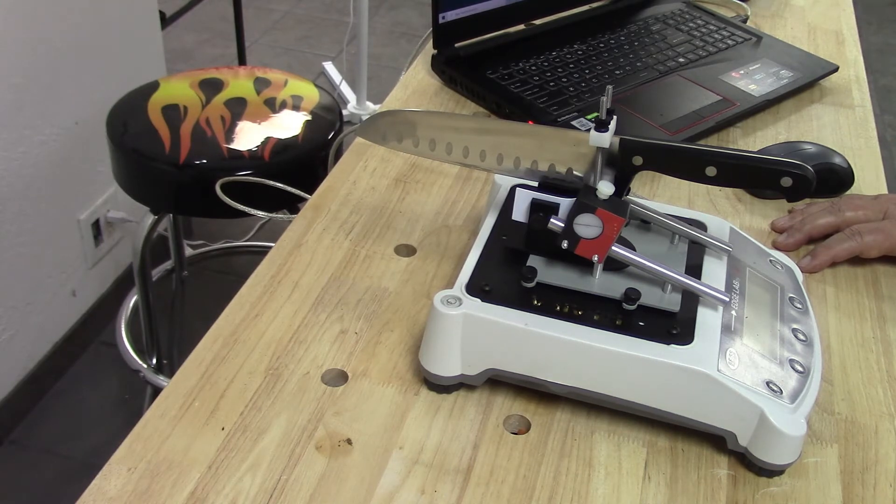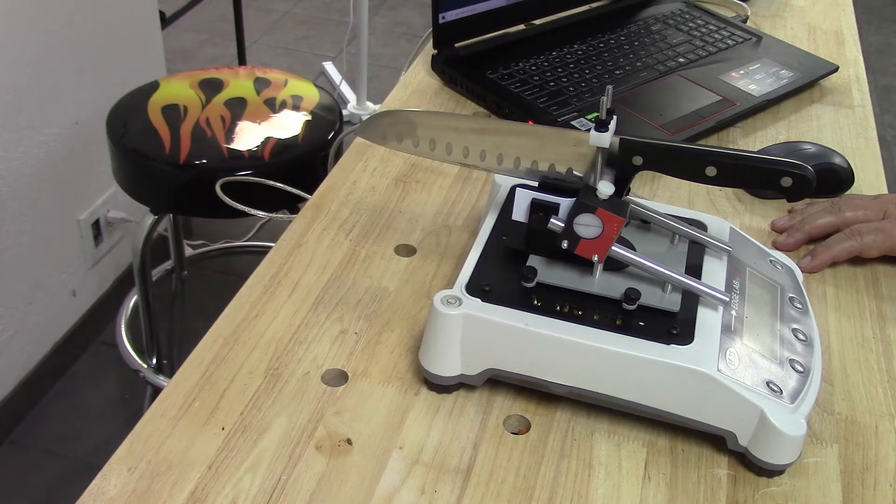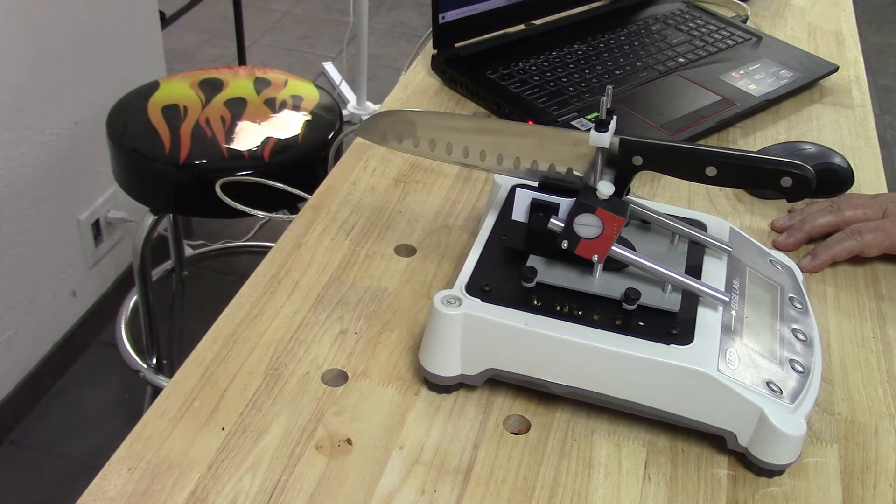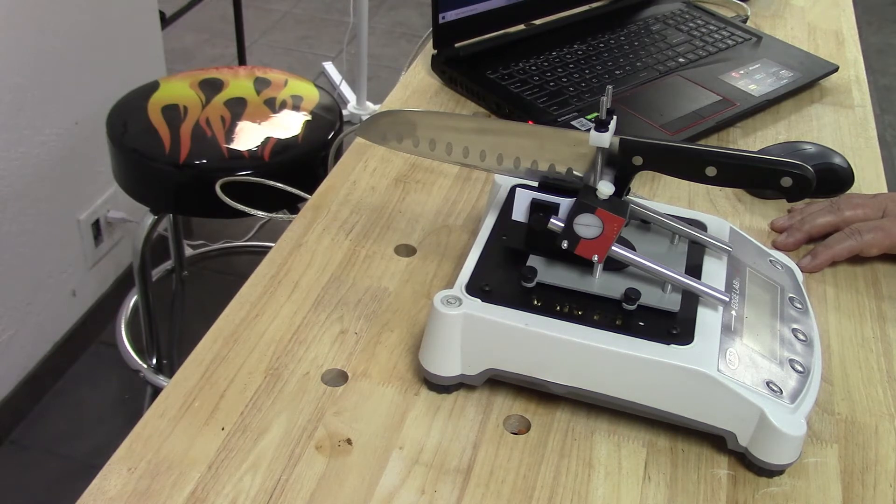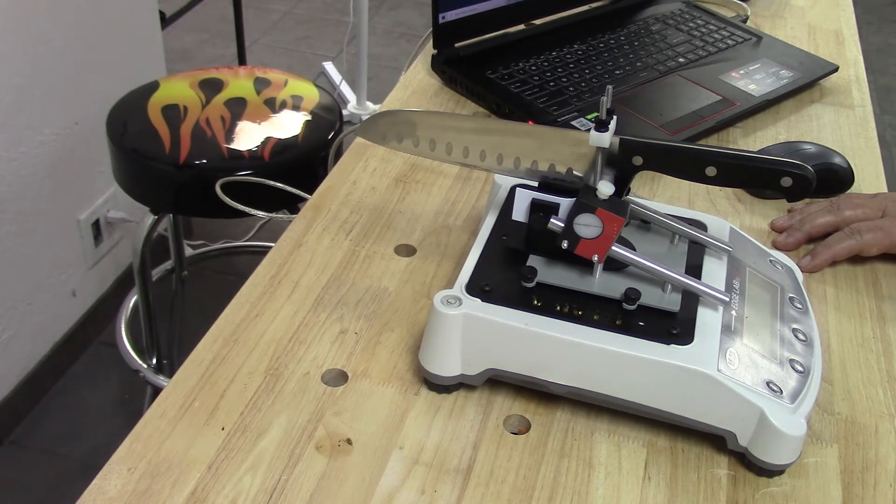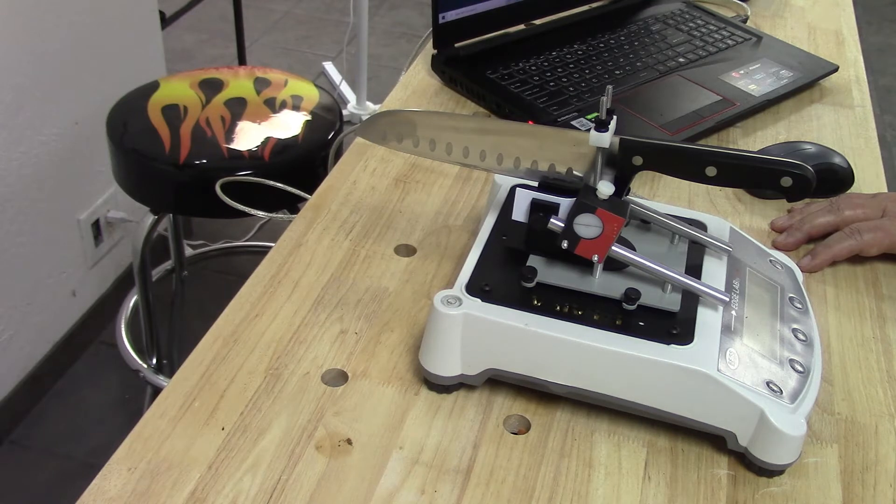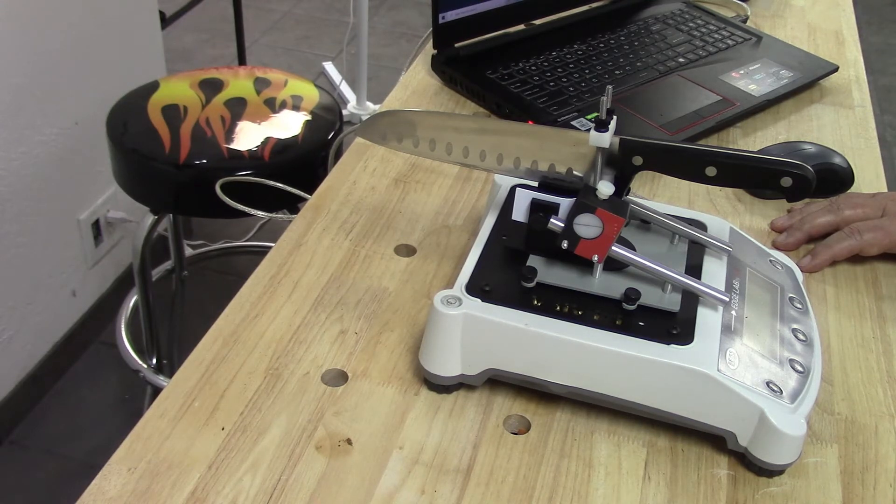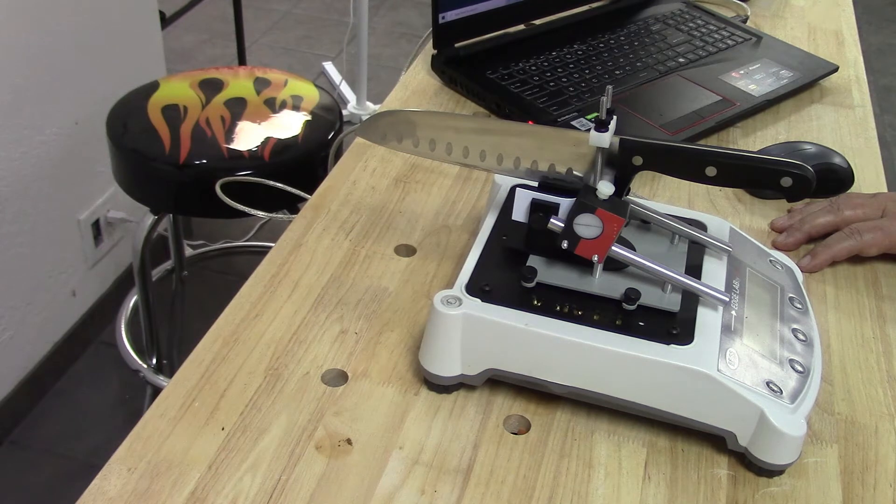I've set the test up to run manually, so I need to go over here and start the test and then we can begin to slice with the CNC 10.